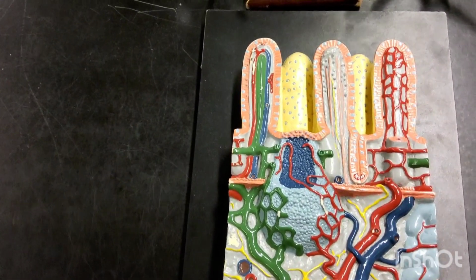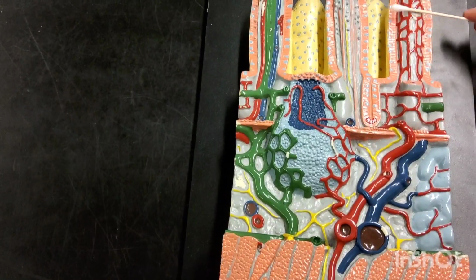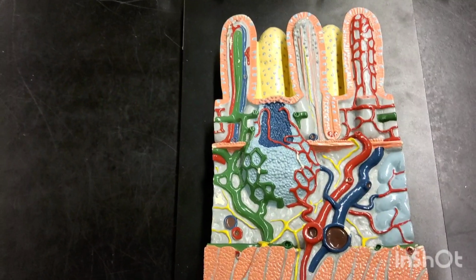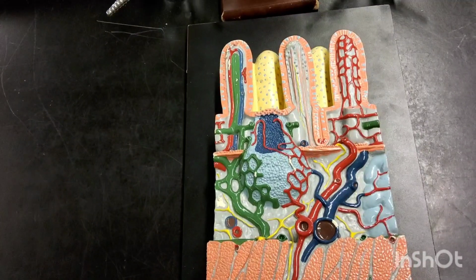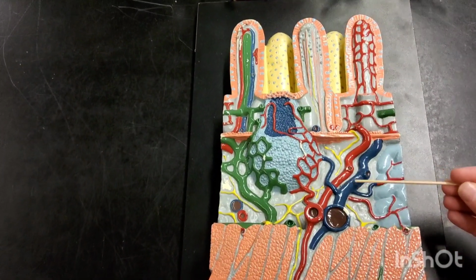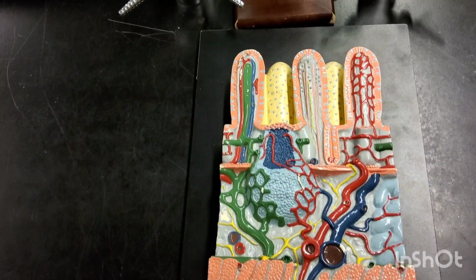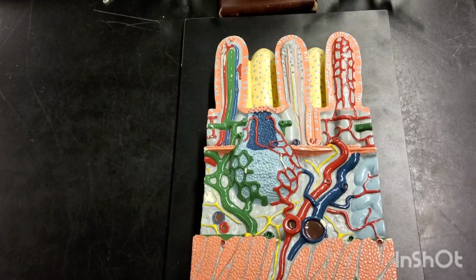Okay. Layer number 2 is our submucosa. So we've moved now from this layer and we're looking directly below it, and boy howdy is there a lot to see here. Our submucosa is mostly dense irregular connective tissue as well as loose areolar connective tissue. So it's quite a mix, and we are going to see many, many blood vessels. We have what looks like arterioles and venules. We're going to have lots and lots of capillaries, and you may also see a lot of lymphatics. These are little lymphatic vessels, and they're all communicating with one another to secrete and exchange substances and get waste out of that system.